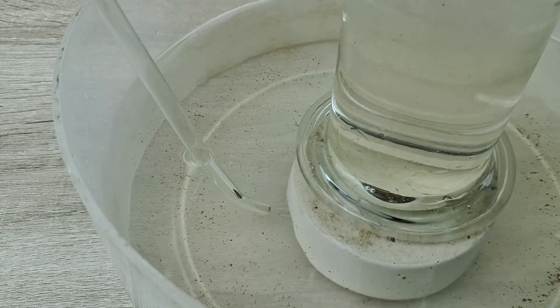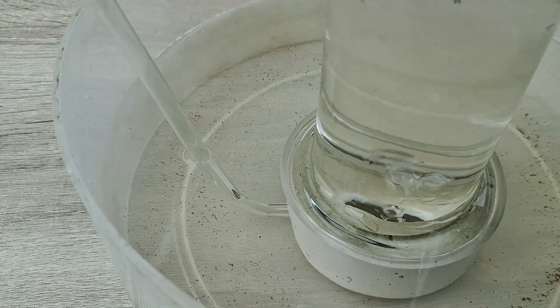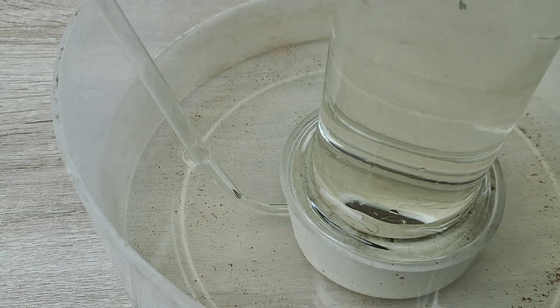You can also use a large test tube instead of a gas jar. Allow the gas to completely fill the jar.